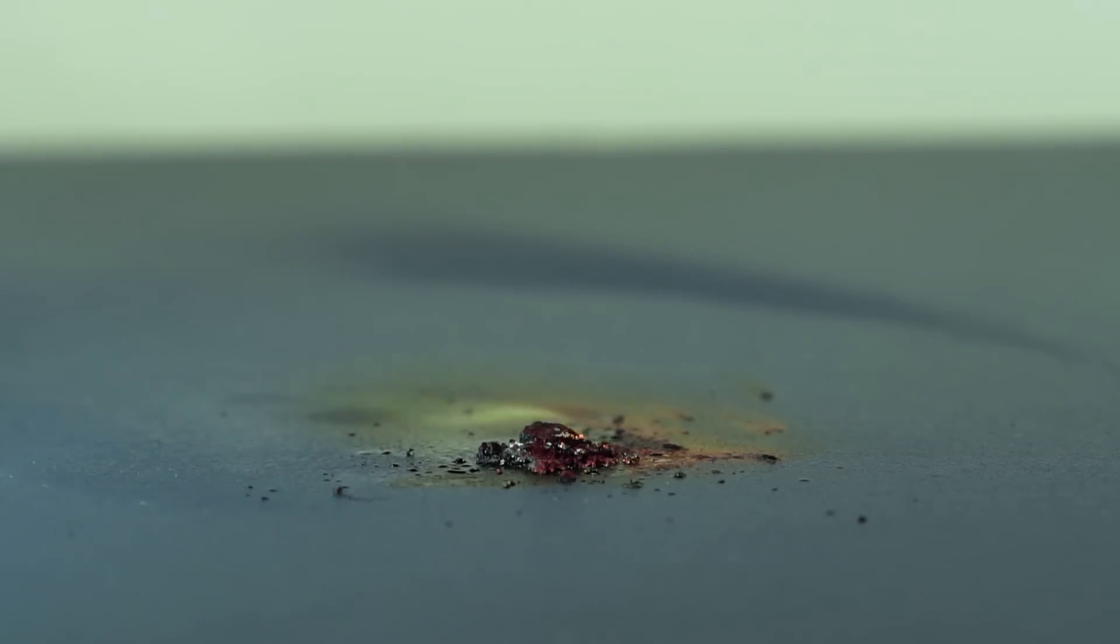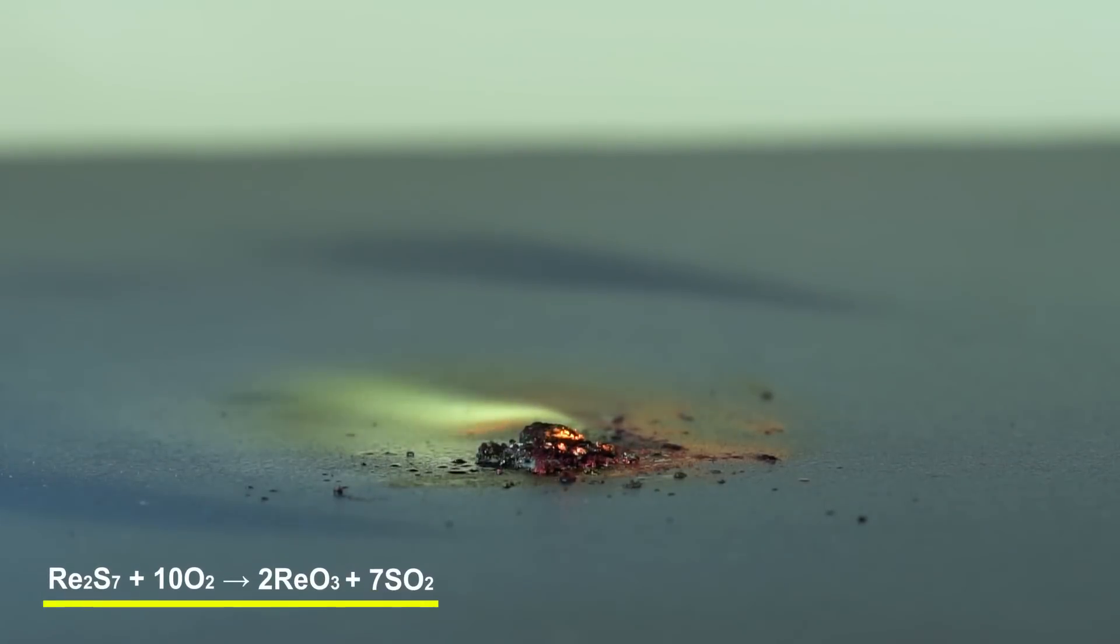Burned down in air, rhenium sulfide forms rhenium trioxide and white smoke that consists of rhenium 7 oxide particles.